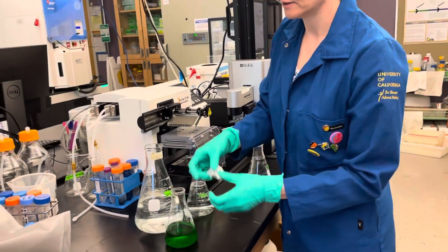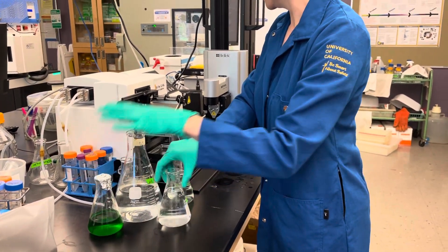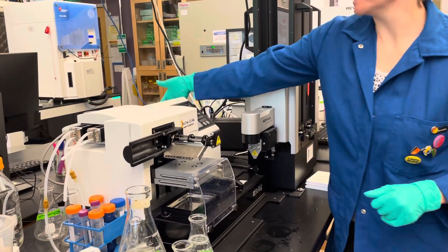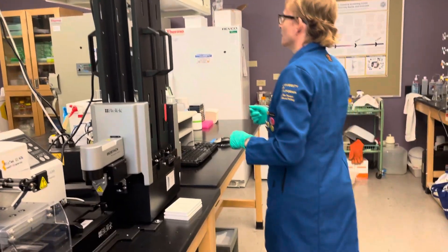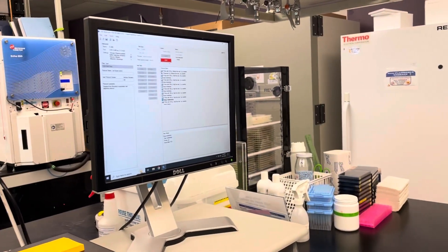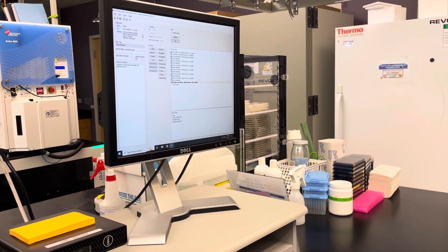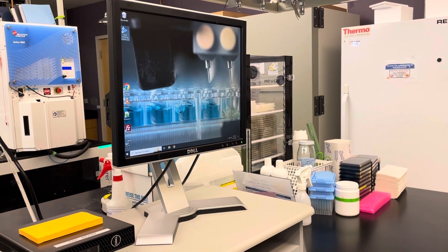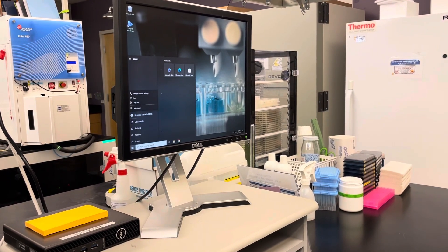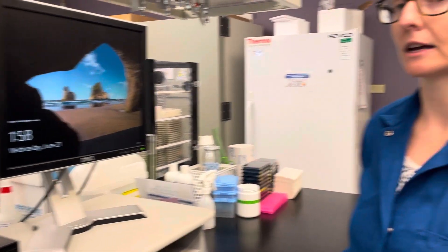Put away whatever samples you brought with you. You may want to wipe off any mess. Turn off the instrument in the back. When you're done with the protocol, just X out the software. Then click on Windows and on your profile icon and say Sign Out. Now it's ready for the next person.